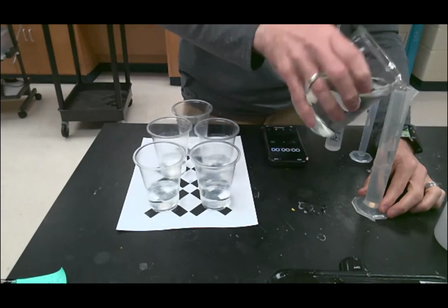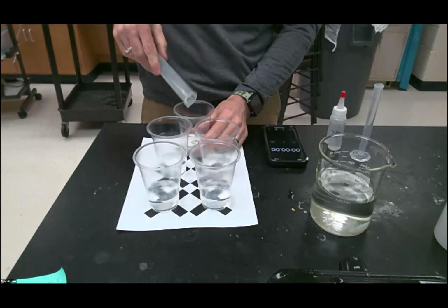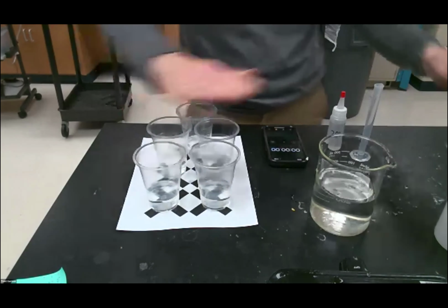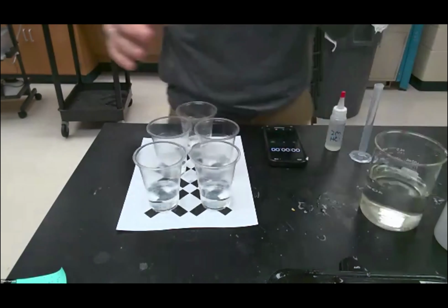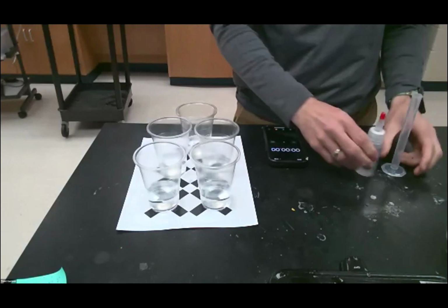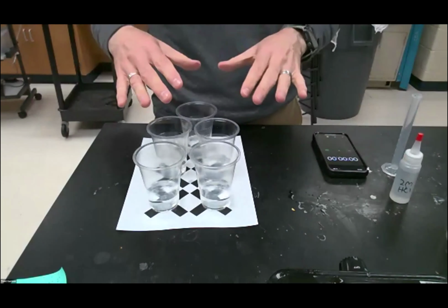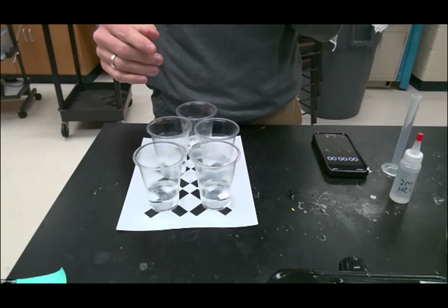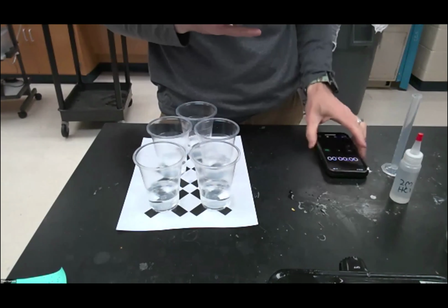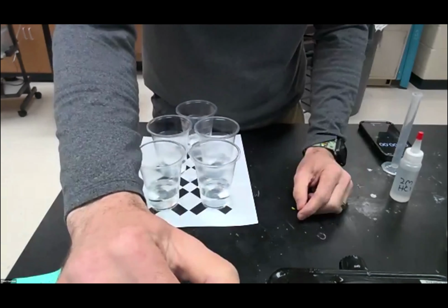We don't ever use 50 milliliters of water because that would have no reaction if you don't put any chemicals in it. Okay, so we have all of these ready to go. Now I'm going to move my camera so that we can start seeing the reactions take place. I'm going to try and hold the camera up above. Unfortunately, my other camera is not working right now, so we're not going to be able to have the overhead vision that I had originally designed.